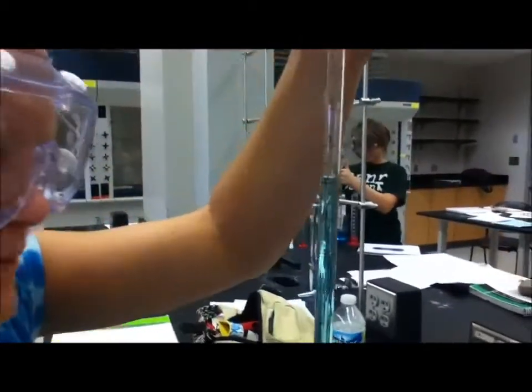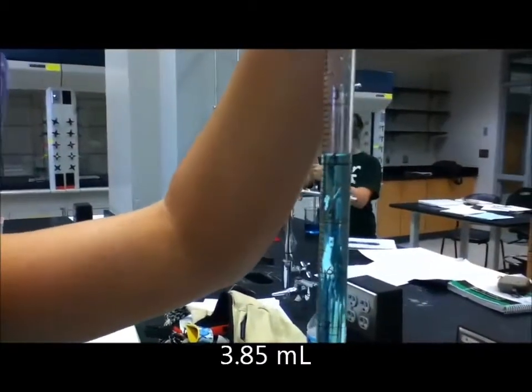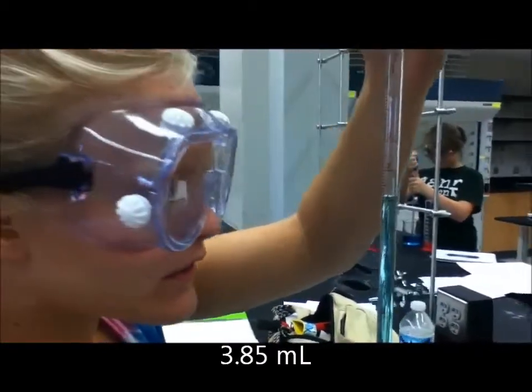Quickly take the bulb off the pipette and replace the cover with the index finger. Now, she is ready to read the results and record the data in her notebook.